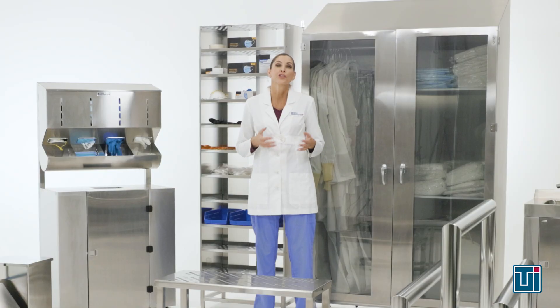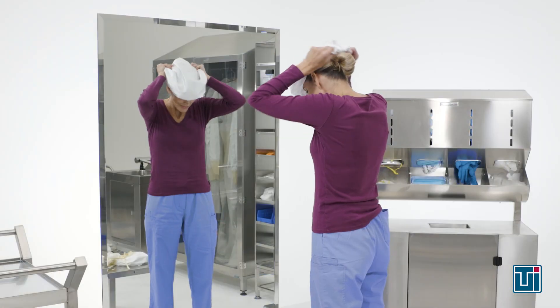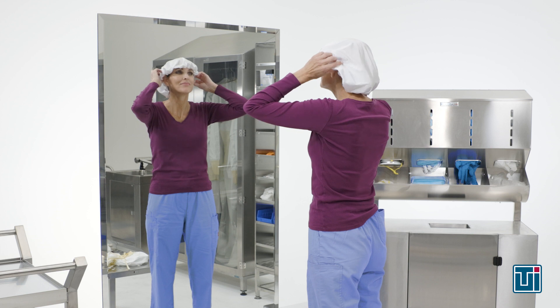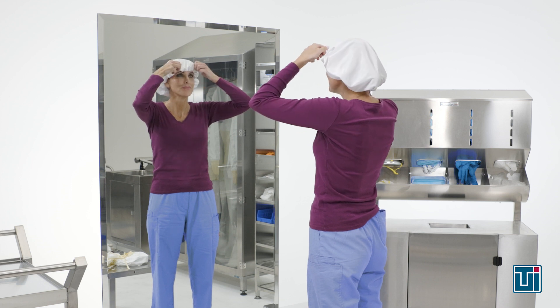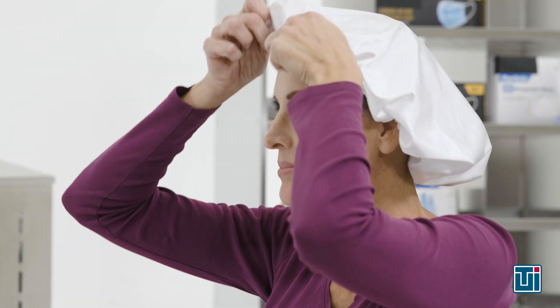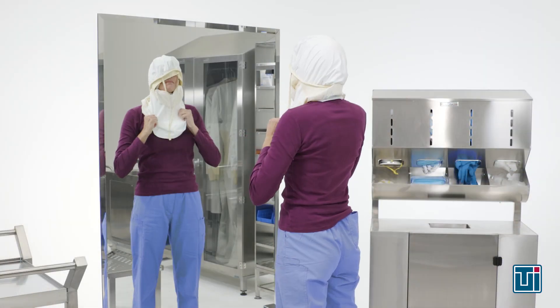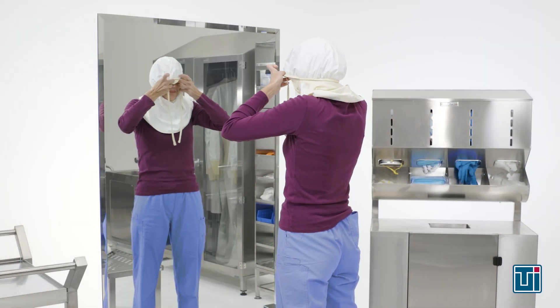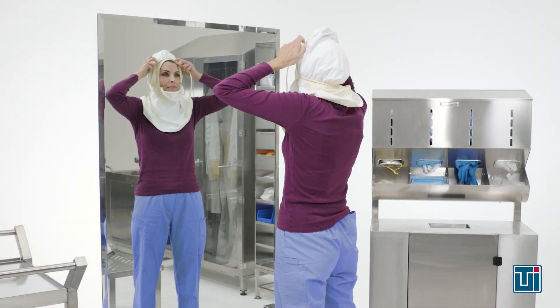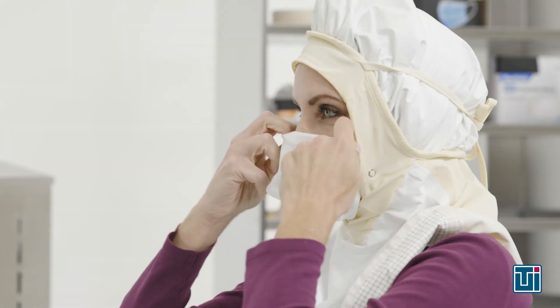First, you'll use a clean bouffant to contain your hair. Men with beards will need a beard cover. Then you'll put on a reusable, freshly laundered hood and attach your face mask.